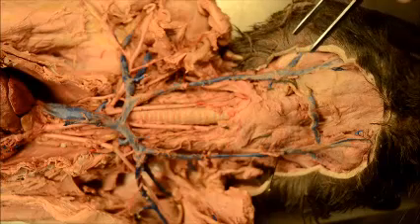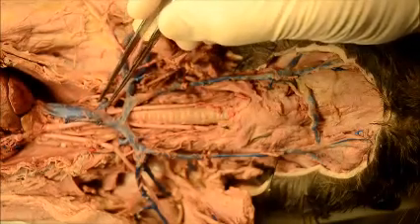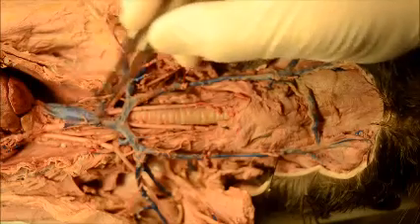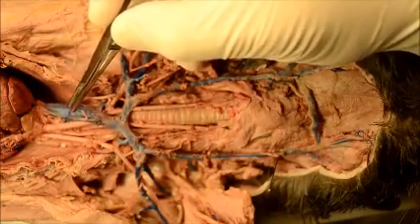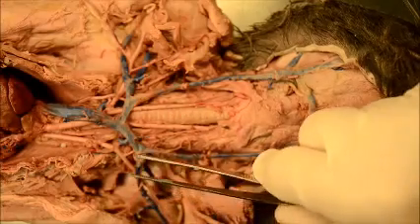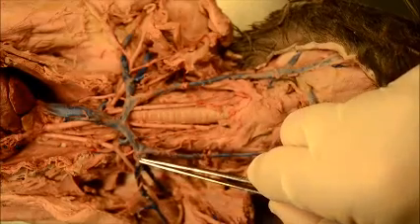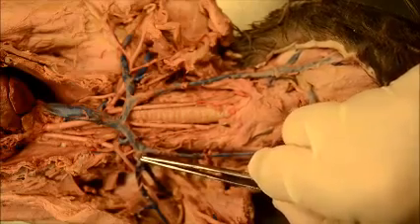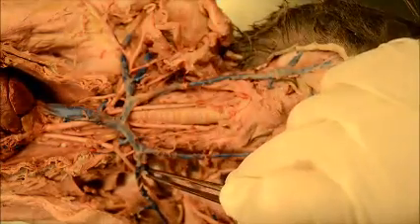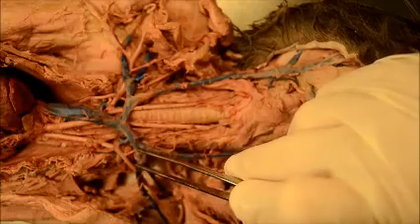I'm going to point out a couple of things. Make sure that you're careful to find the vertebral because they're not symmetrical — it doesn't come off the same vessel. On this cat it comes off the superior vena cava and the brachiocephalic. The next thing I wanted to emphasize is that the subclavian is that really short area, so an exam pin could be placed right here. Students always make a mistake on that. What gives it away is you see the external jugular coming up this way, and the subscapular goes downward — so that's why this area here to here is the subclavian.